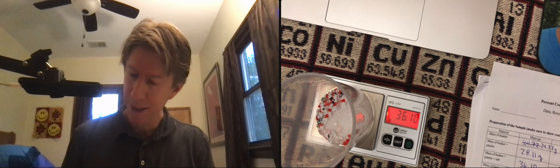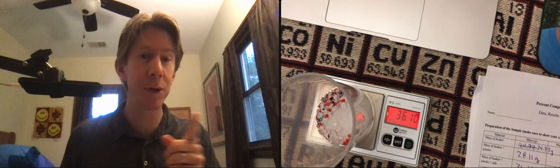You don't want much smaller than 6 and you don't want much more than 14, but just a spoonful. What's important is that you get the actual mass.